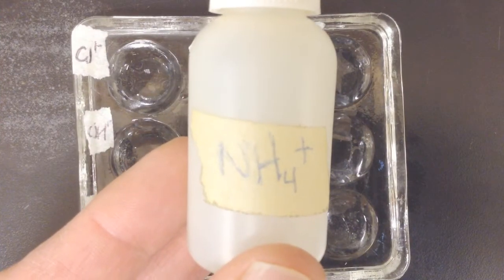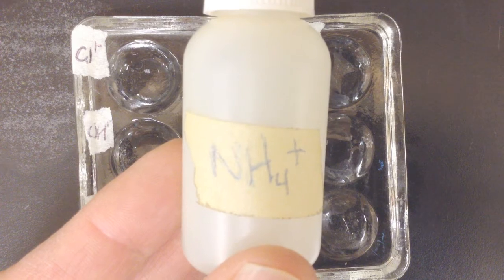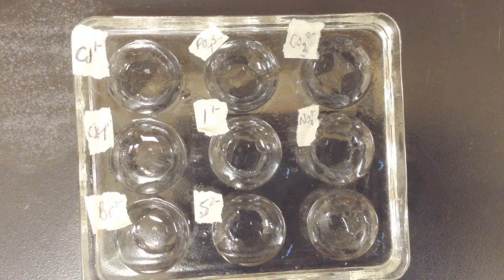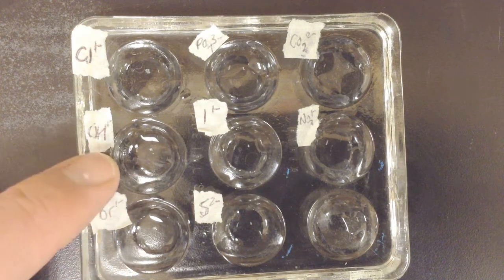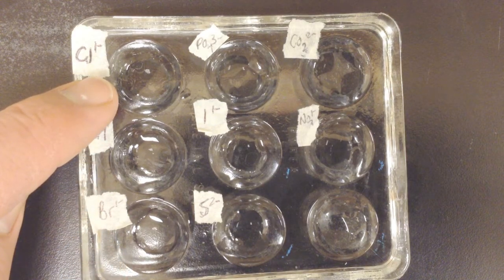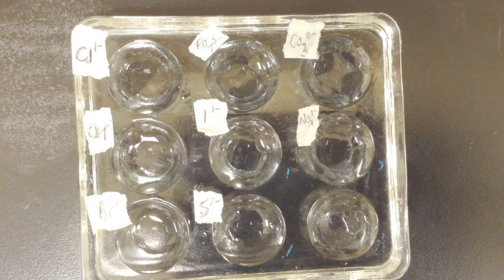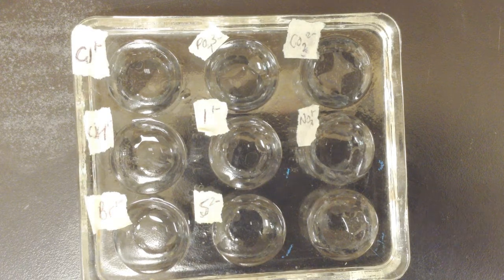All right, next up is ammonium, NH4 with a 1+ charge. You can see, pre-recorded again, this lab is starting off without much excitement on the precipitate front. We've added ammonium with all of these anions, and you can see that none of them formed a solid precipitate. Let's move along to the next one on your list, that is lead.